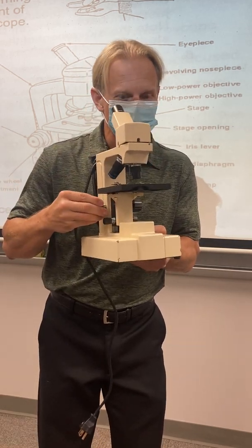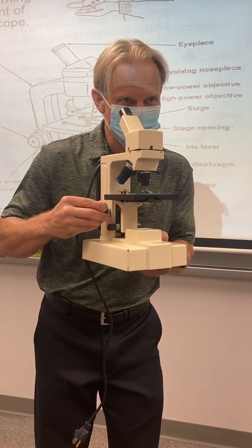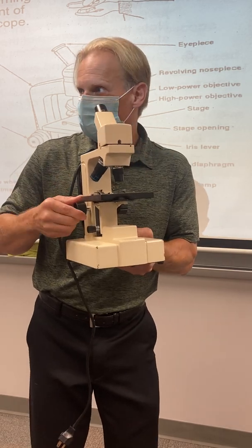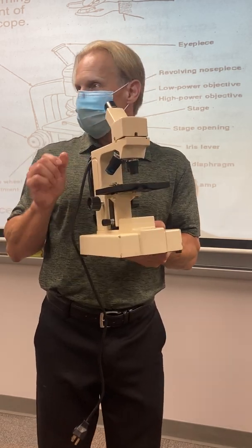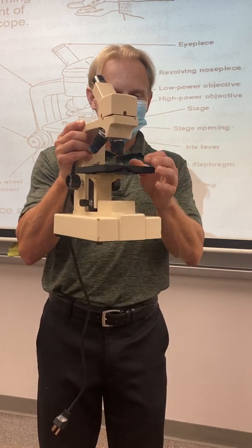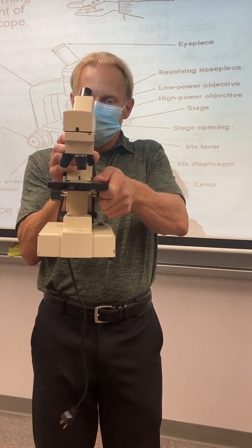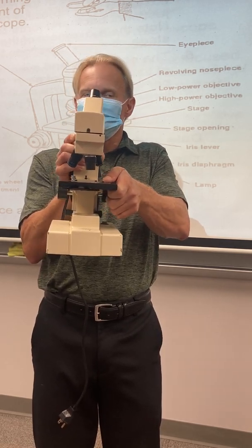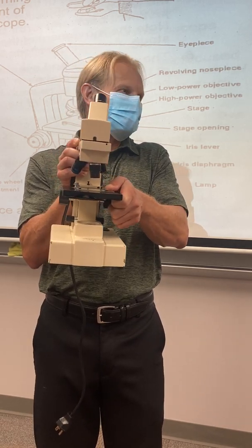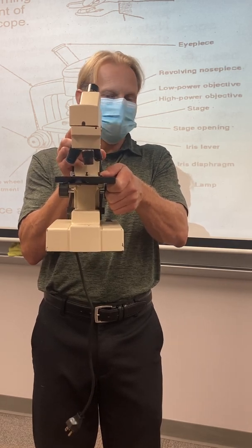And as I look through it, I'm going to use this coarse adjustment knob to slowly back the stage away. See it going down? And as you do that, you're going to hit a spot where it's like, ooh, it's almost there, and you'll give it a little wiggle, and you'll get it really close. It'll look really good, okay? Once you've got that, you might have to grab the slide. Don't be afraid to grab this thing with both thumbs and slide it around, move it some. You're going to be surprised because you're going to move it one way with your fingers, and you're going to see it go the other way with your eye, okay? So move it around, get it centered really good.